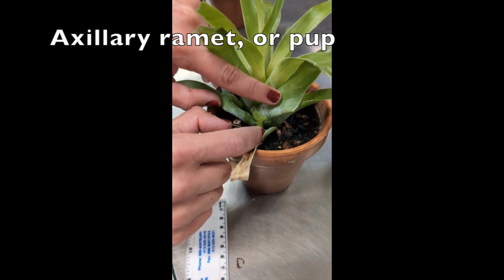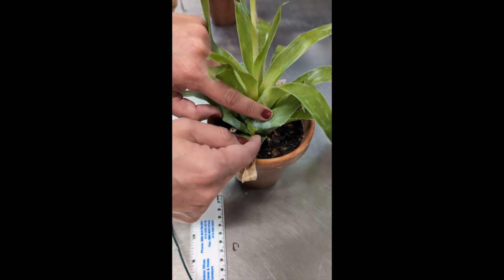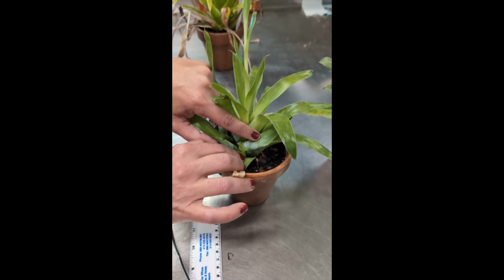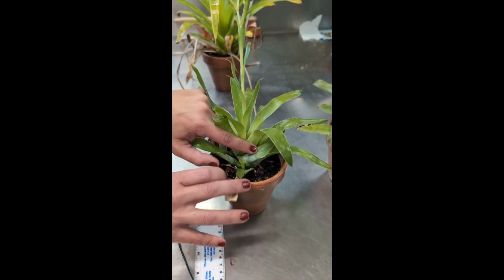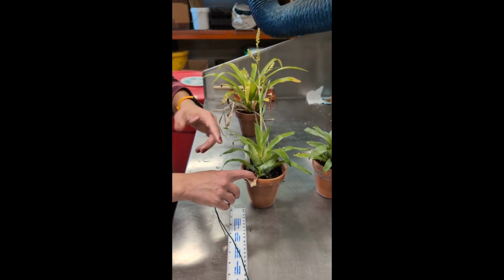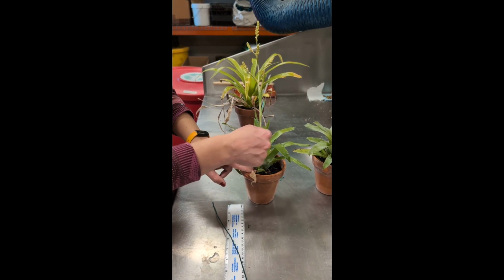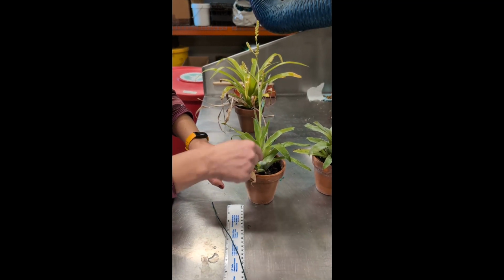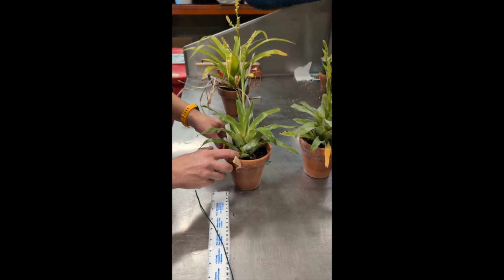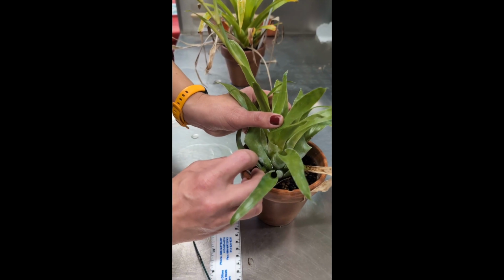These are called axillary ramets or pups. This is a genetic clone of the big parental ramet here. They are connected at this point, and probably there's exchange of materials happening there, but we don't actually know much about that. Am I providing any sugar this way or this way, water? We really don't know. But in this case, here's an axillary ramet, here's another little one, etc., etc.